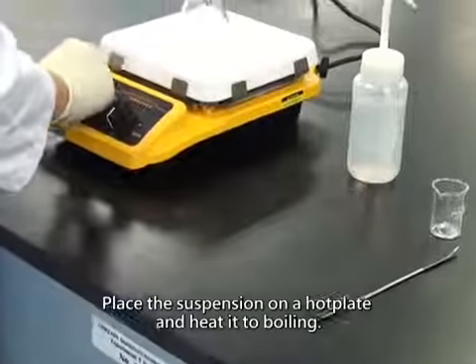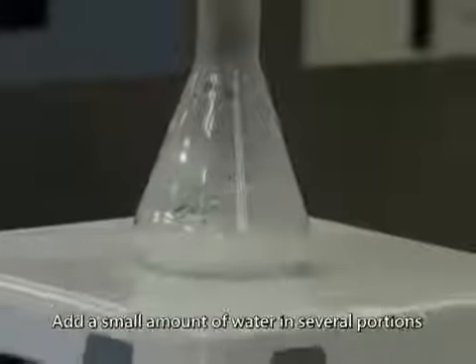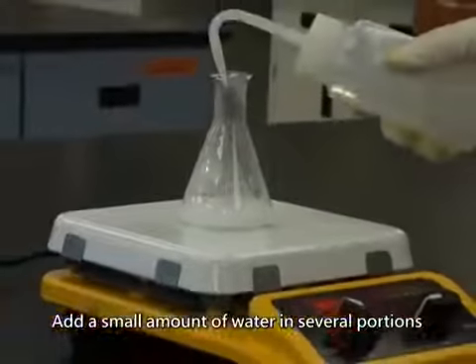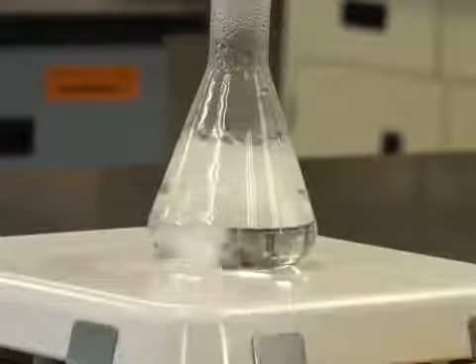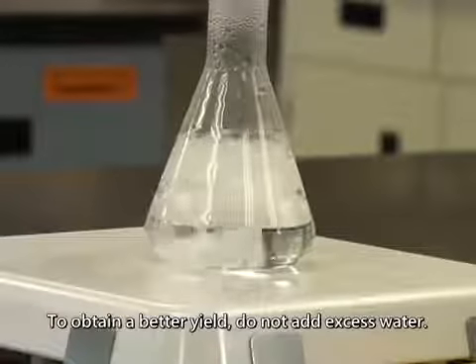Place the suspension on a hot plate and heat it to boiling. Add a small amount of water in several portions until the solid dissolves completely. To obtain a better yield, do not add excess water.